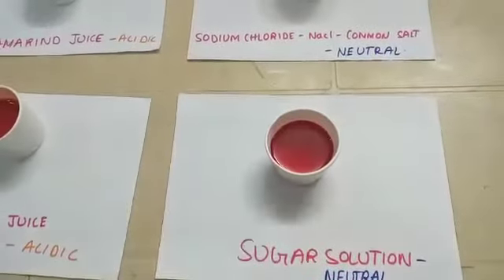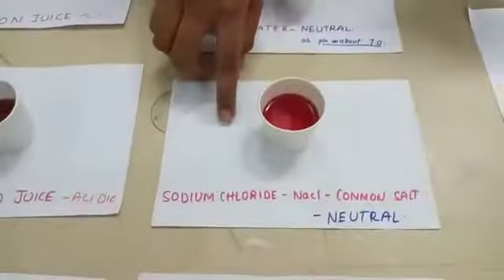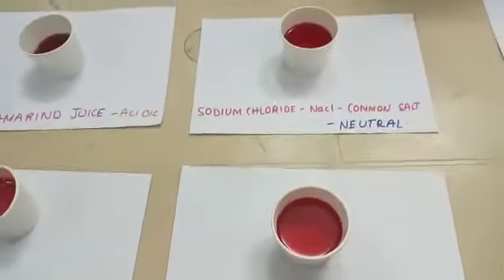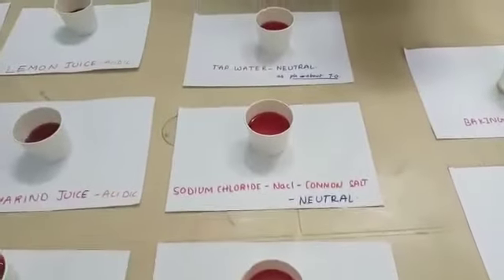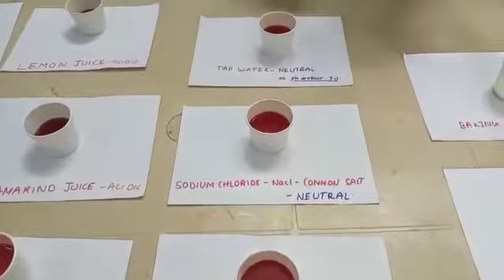When coming to tap water — this is tap water. This is sodium chloride, NaCl, common salt. And this is sugar solution. These 3 are of the same medium, that is neutral. They appear light pinkish red.